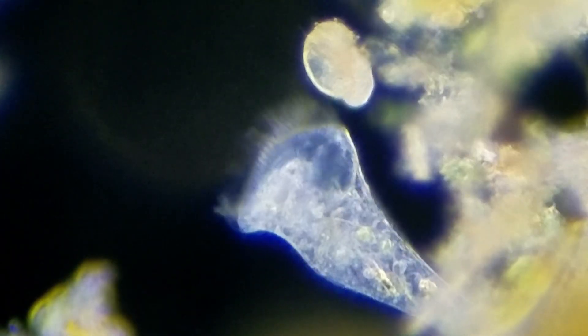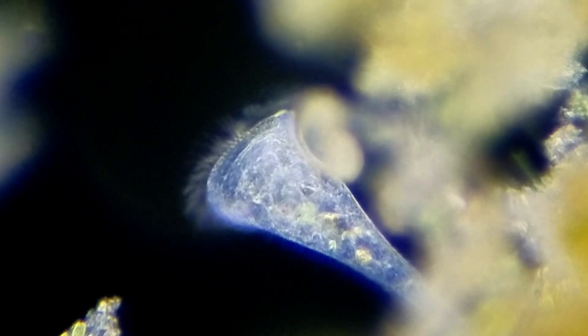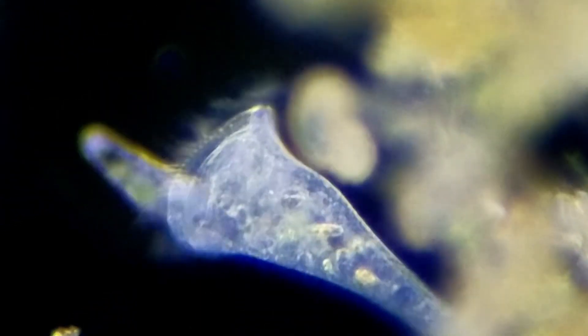They can move in just about any direction they want to move, and you'll find them just about anywhere. This is pond water with algae — this golden part right here under the dark field filter is algae.